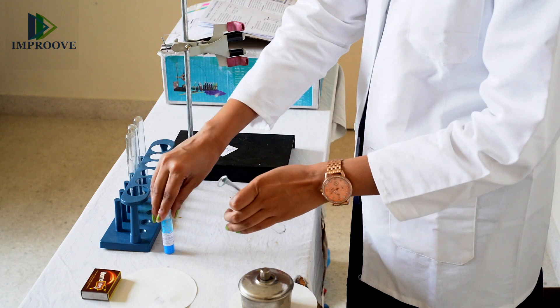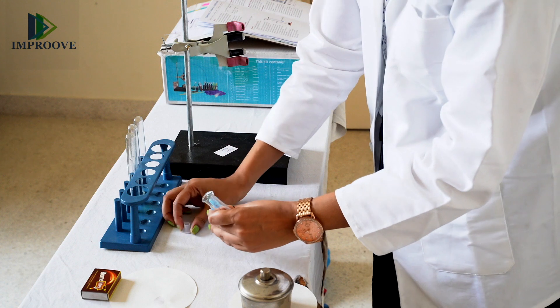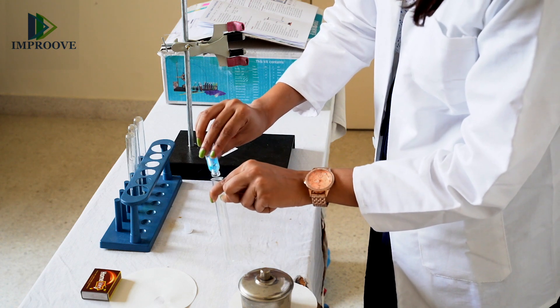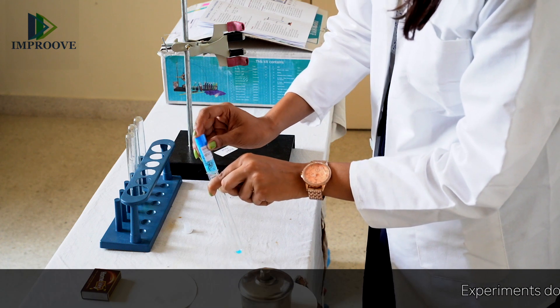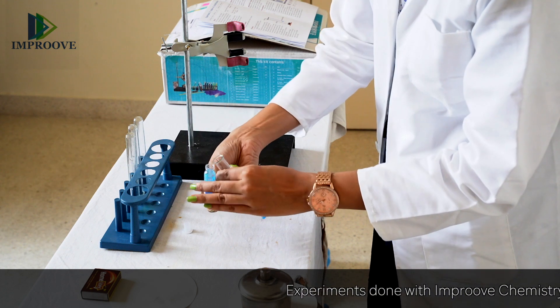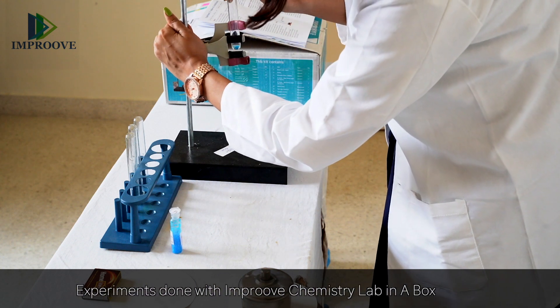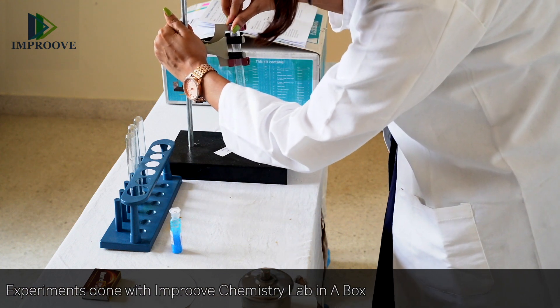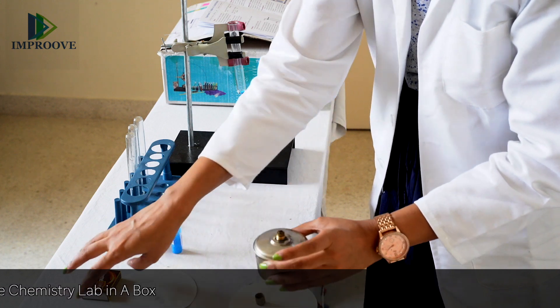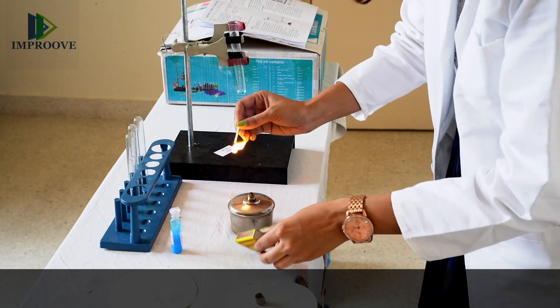Take a clean and dry test tube. In this test tube, place some crystals of copper sulphate and then fix it in the clamp. Then take your spirit lamp, light it, and allow the test tube to heat for some time until you observe any colour change.